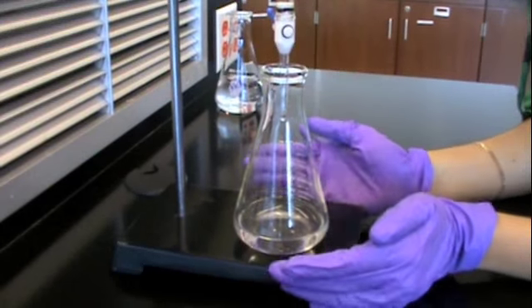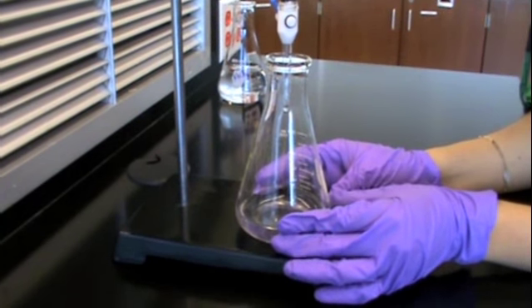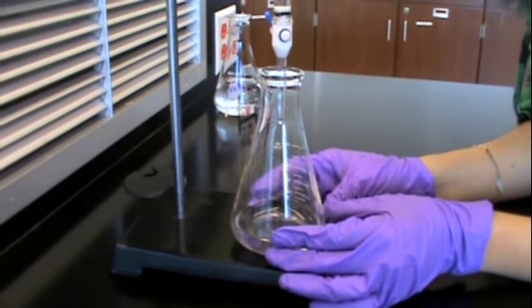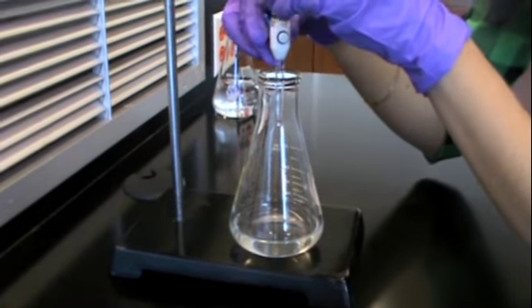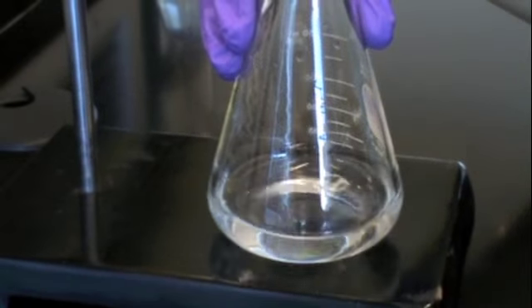The titration will be complete when the solution turns slightly pink. Therefore, you have to be very careful and go drop by drop whenever the color remains longer. For example, look at this. It remains for a longer time, especially when you swirl it. That means we're getting closer. Whenever it turns slightly pink, it means that it has turned basic.